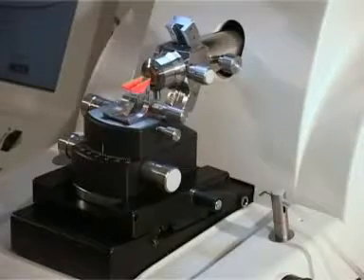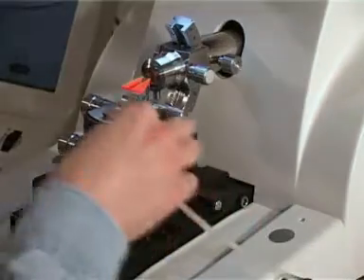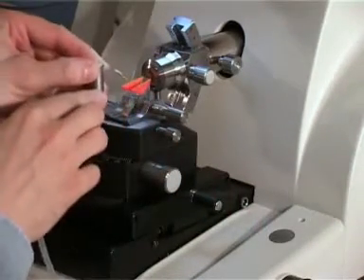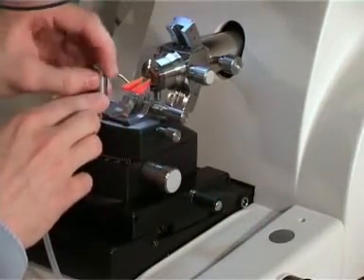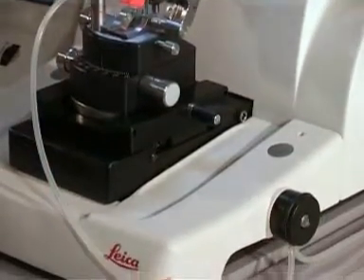Once alignment is completed, the cutting window is set and the specimen placed below the knife edge before the boat is filled with water. Using the top light illumination, the spout of the reflexomat water pump is positioned and the trough is filled with water.